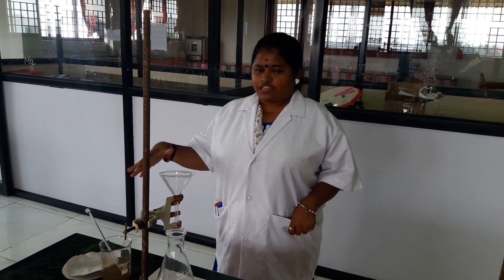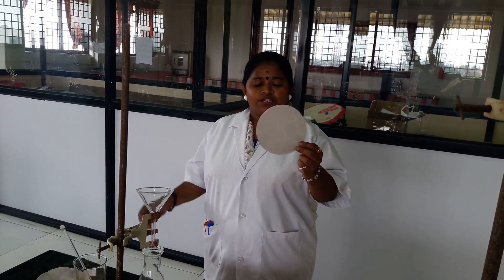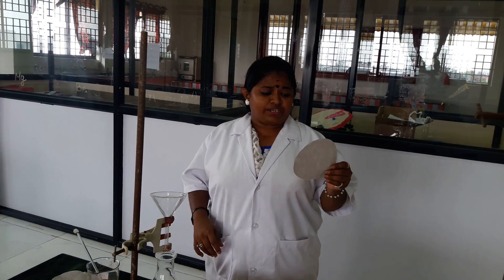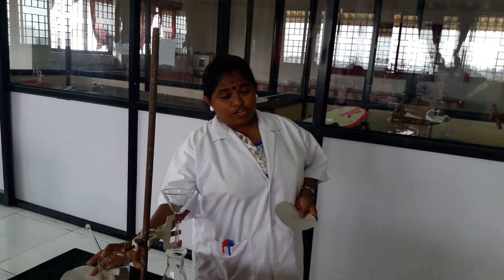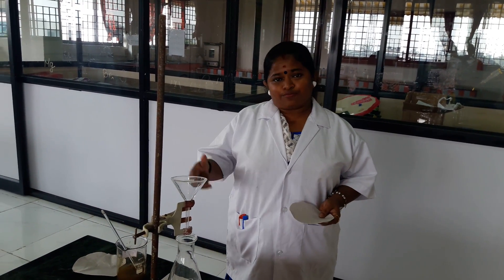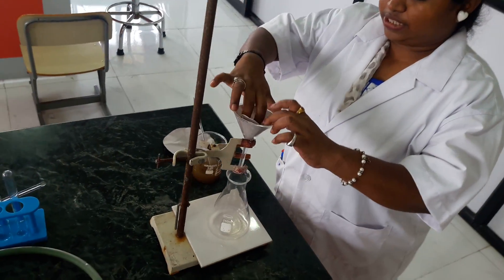First we are going to see about filtration. Filtration is a very common separating method. We have filter paper here. Filter paper has minute pores which might not be visible to us, but they allow water molecules to pass through while holding back the sand particles. We are going to use soil in water. I am holding it like this to fit it into the funnel.